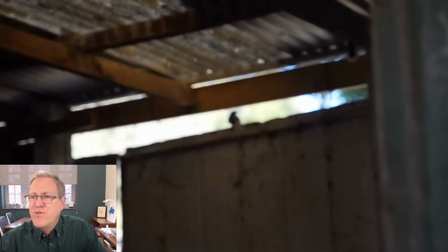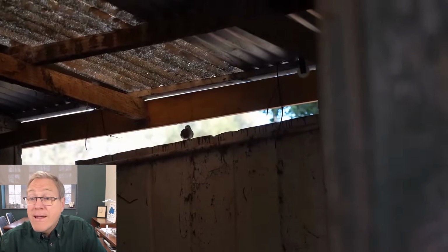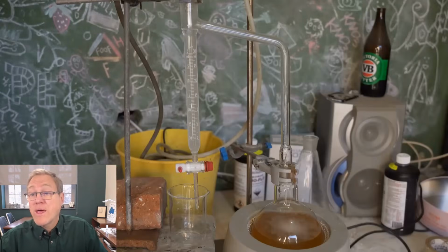That's weird. Let's get a nice view of the setup. There's the bird again. Hello, Mr. Bird. Okay, that's a good setup.